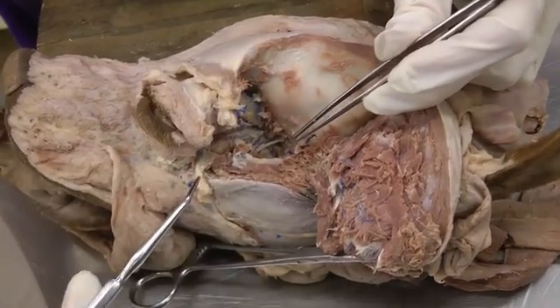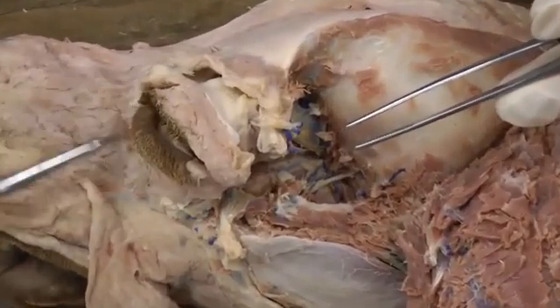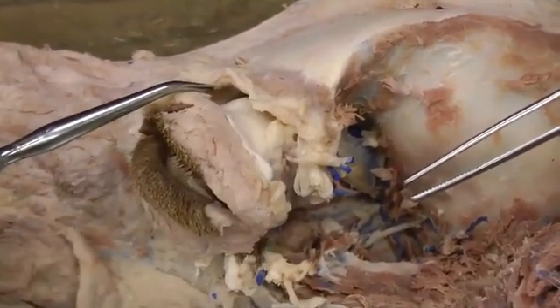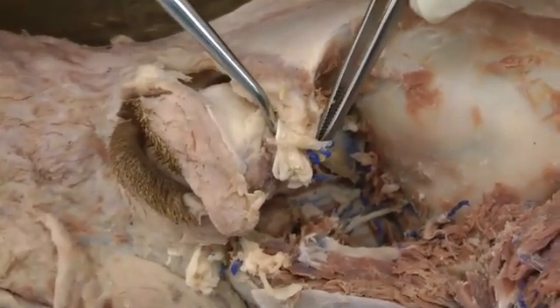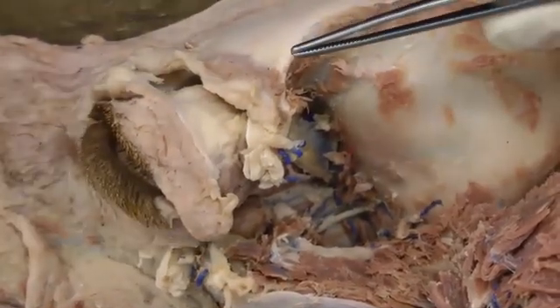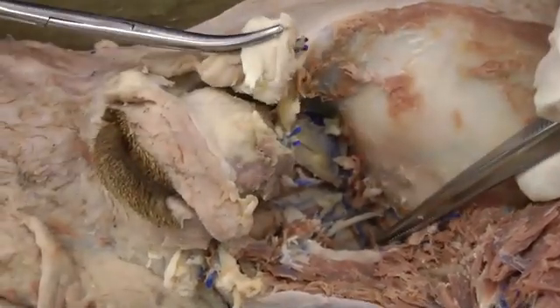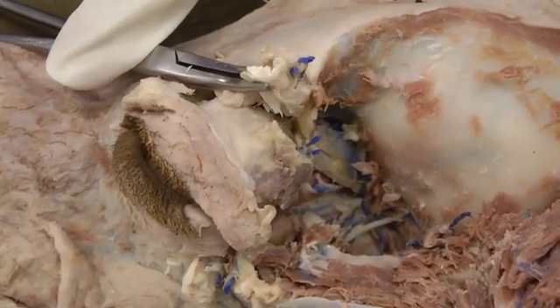We're going to be doing some muscles first. The orbit is the conical cavity that holds the eyeball, right here. In the dog, the orbit is bony only up until a certain point, and then it has an orbital ligament. You're going to have to cut that and reflect it — I just use a hemostat and pull it out of the way after cutting it.